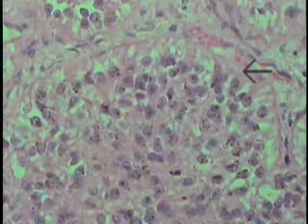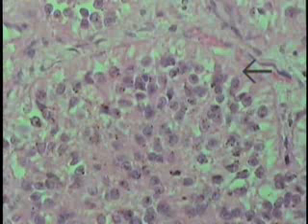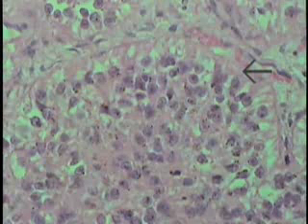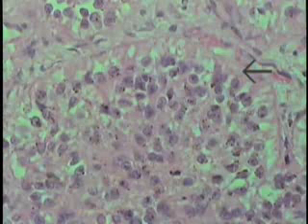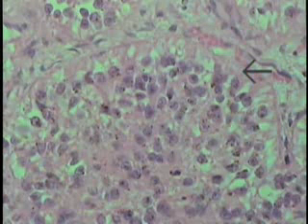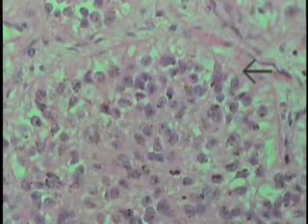Remember, this is a photoendocrine type of gland. It receives signals via the retina from light, and through a series of neuron chains, the superior cervical ganglion sends postganglionic sympathetic fibers that innervate and control the secretion of this gland. The principal hormone secreted by the pineal in human beings is melatonin.